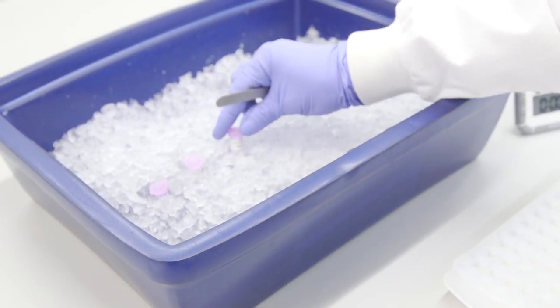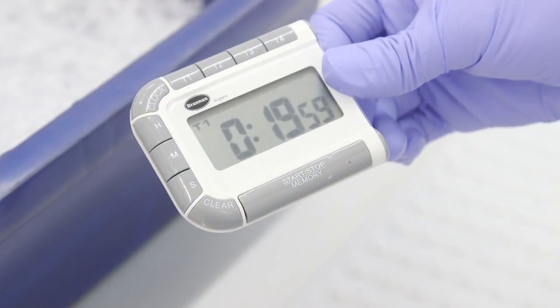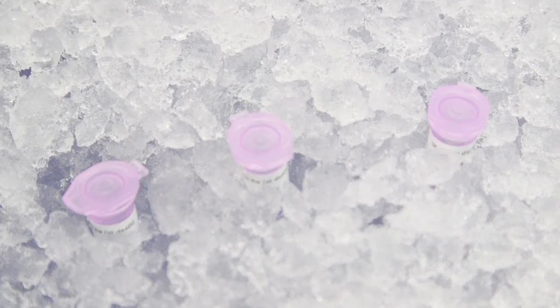This step fixes and permeabilizes the tissue, allowing staining to be performed later in another protocol.